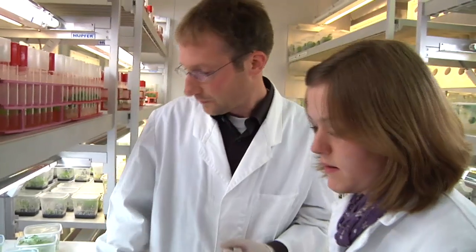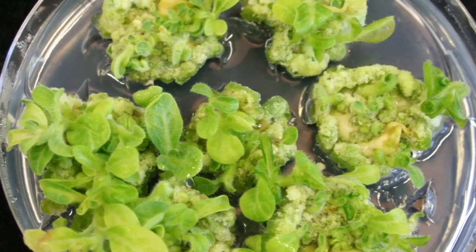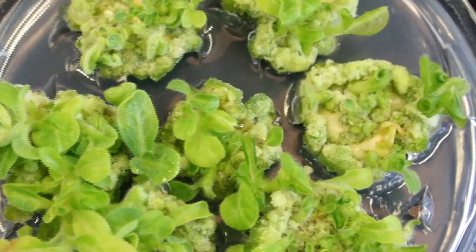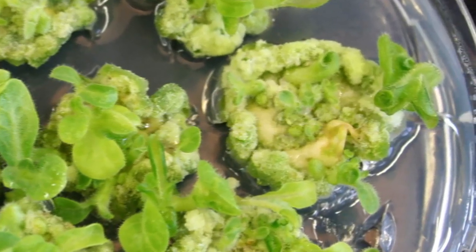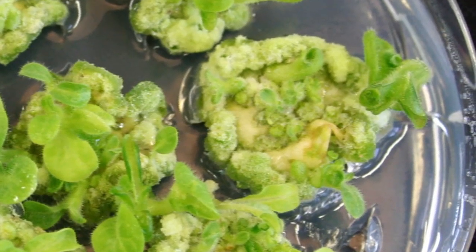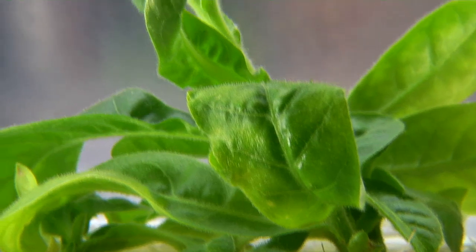Here in the climate chamber, we grow our plants. You can see different stages of development, starting with the leaf discs, then the very small plants, and finally fully grown young tobacco plants.